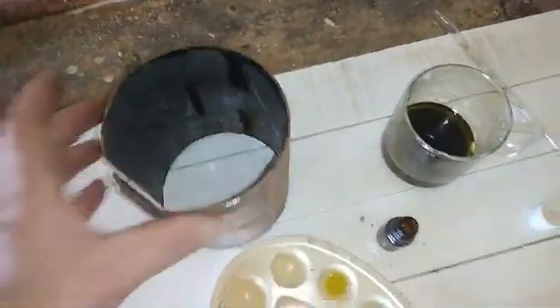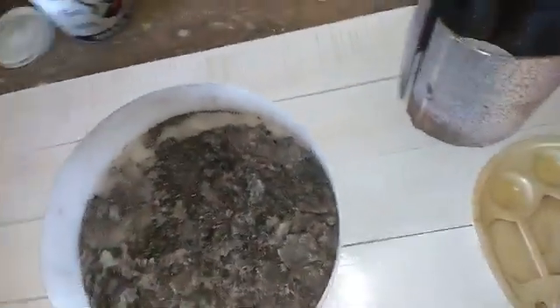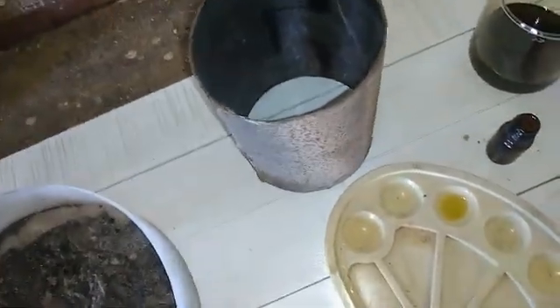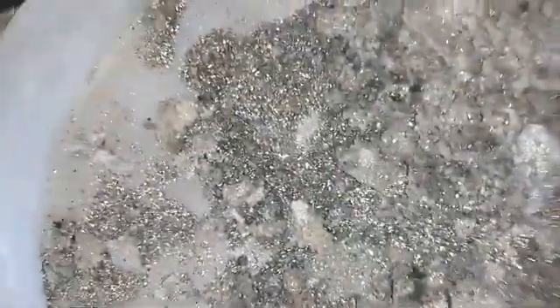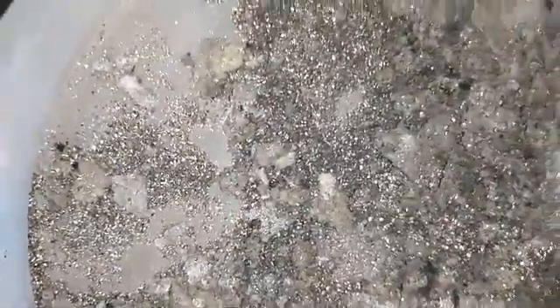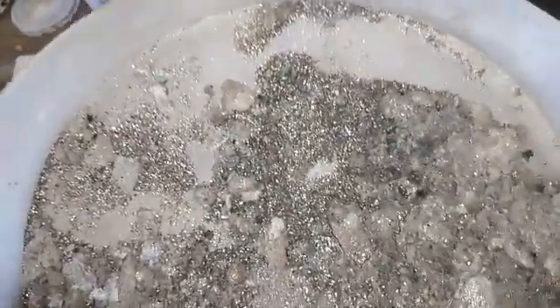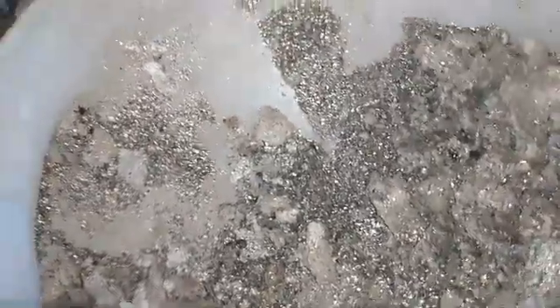This isolation covers this metal round, and from that converter catalyst I got 0.7, 0.8 gram pure platinum. I left these for the next testing videos, but nothing to see because I tested that and the result is actually nothing.